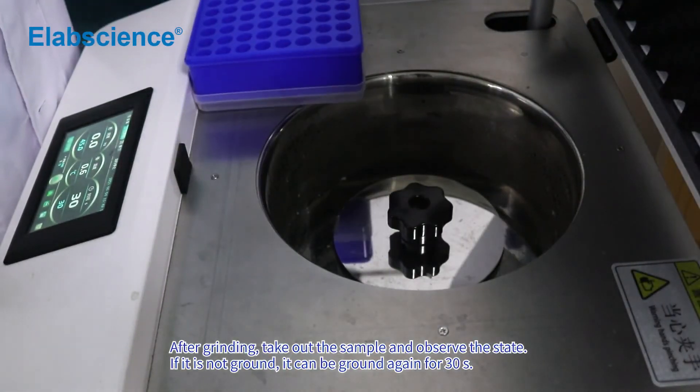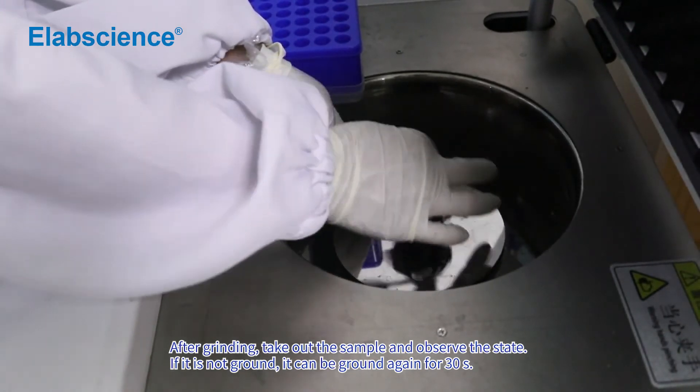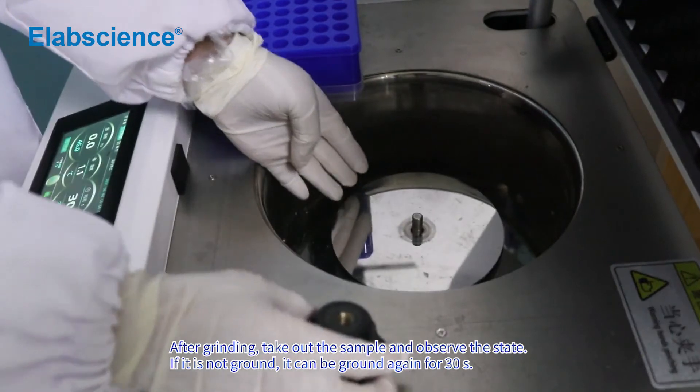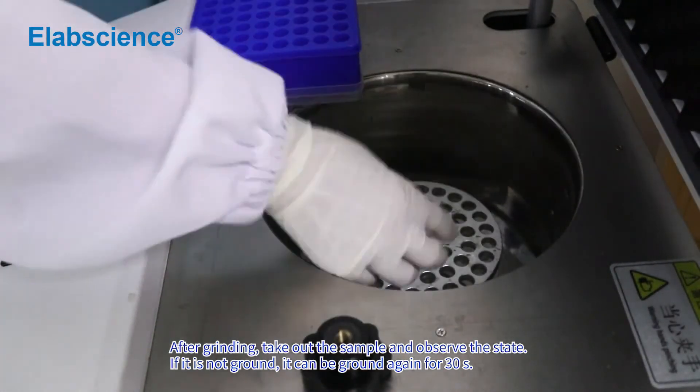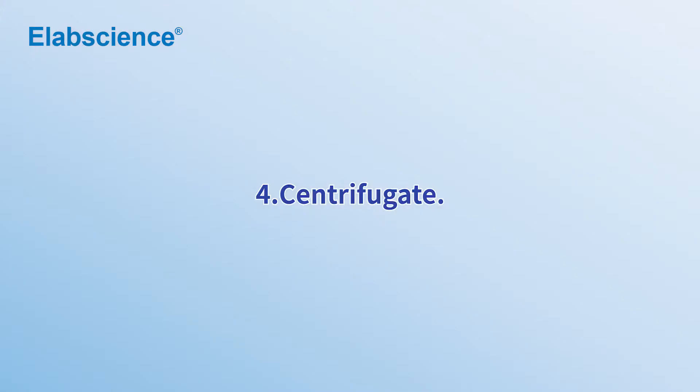After grinding, take out the sample and observe the state. If it is not ground, it can be ground again for 30 seconds. Centrifugate.